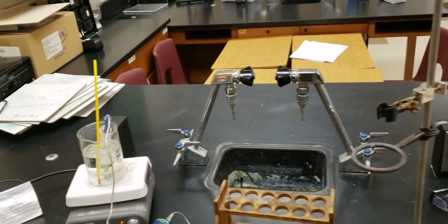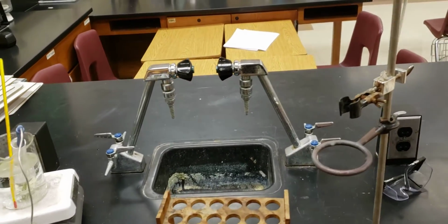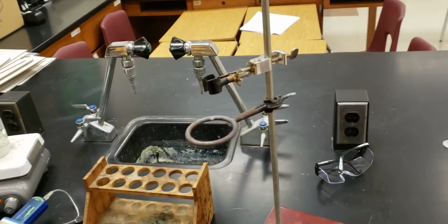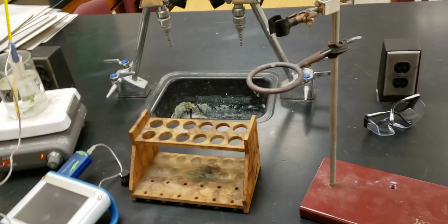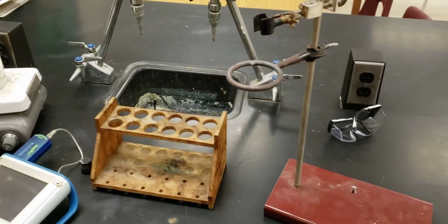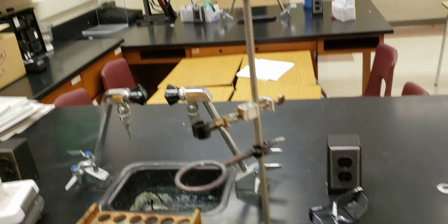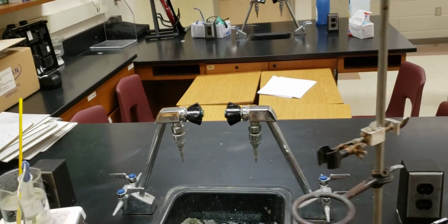In this lab, what you are going to be doing is tracing out the heating and cooling curves of a particular substance, and then you are going to graph that substance out. In general, this is a way to verify that heating and cooling curves exist, and this will show you how to do those types of measurements.